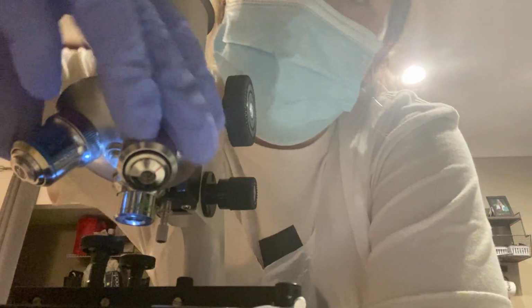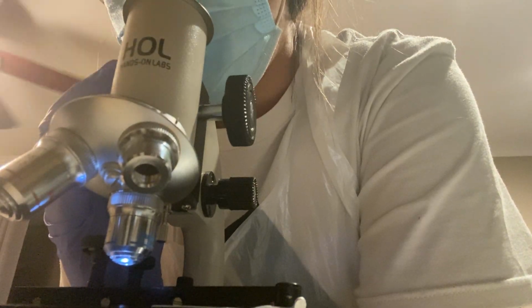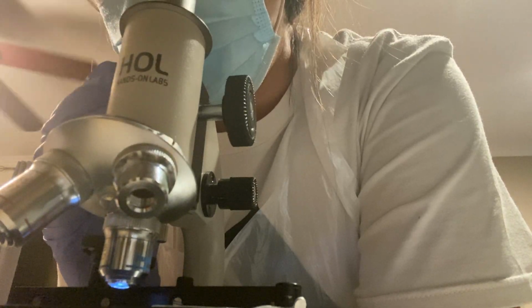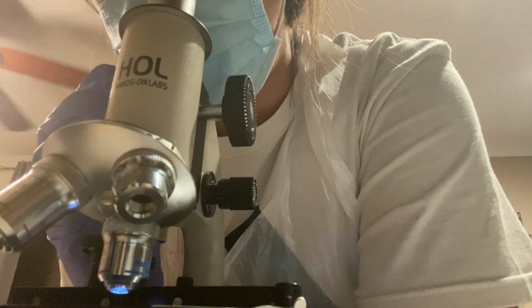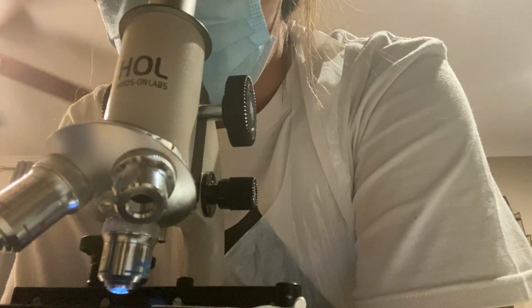I'm gonna switch it over to medium. Okay, I'm getting something here. Okay, so I focused it, and I can see the sample.